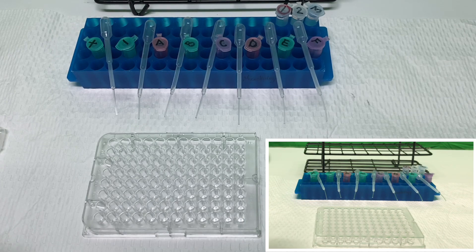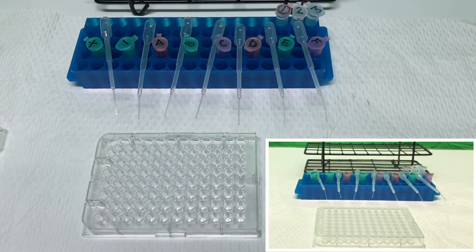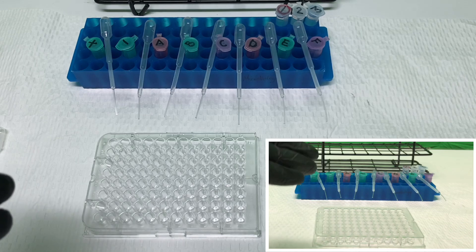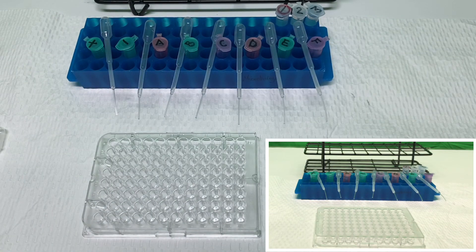We'll take the plate. To each of the wells, we'll add a positive control, a negative control, as well as the six possible samples, A through F.